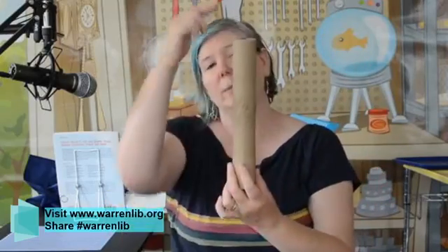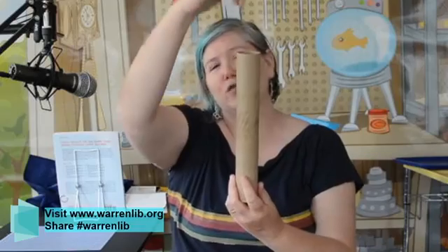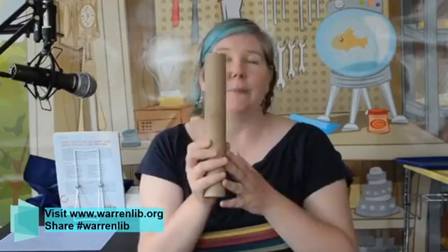All right, so what are you going to need for this activity? You're going to start off with a toilet paper tube or a paper towel tube. Now, if you don't have one of these, an oatmeal box will work. Any kind of tall box will actually work for this really well. You just want something that's going to be tall because you want the light to be able to travel a bit of distance so that it refracts well. It breaks up well for our spectrometer. Toilet paper tube or a paper towel tube is pretty perfect, but like I said, wrapping paper tubes, oatmeal can, anything like that will totally work.